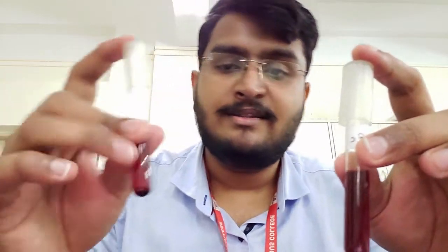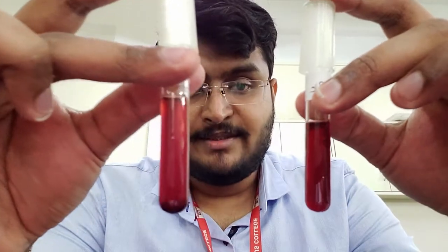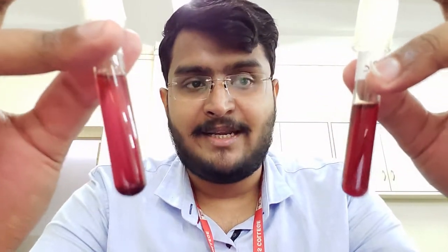You can also see that the suspensions containing E. coli and S. aureus are both completely hemolyzed — the entire tube has turned red and remains red even after centrifugation, indicating the RBCs have been lysed. Similarly, S. pyogenes also shows complete lysis. All four strains — S. pyogenes, S. aureus, E. coli, and the alpha-hemolytic strain — are carrying out evident hemolysis, indicating they are producing hemolysin.